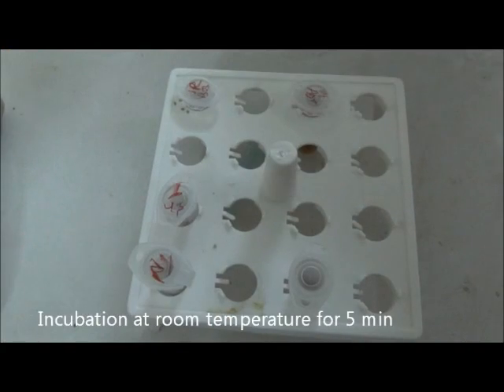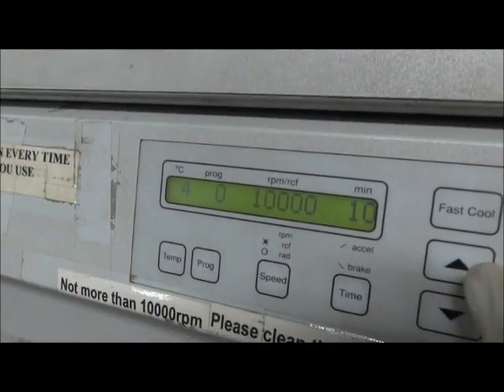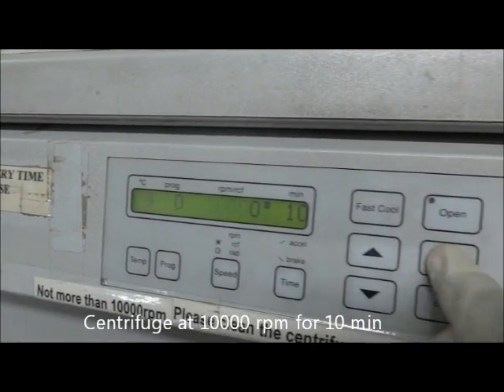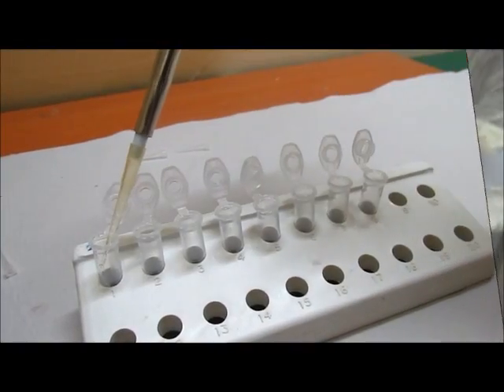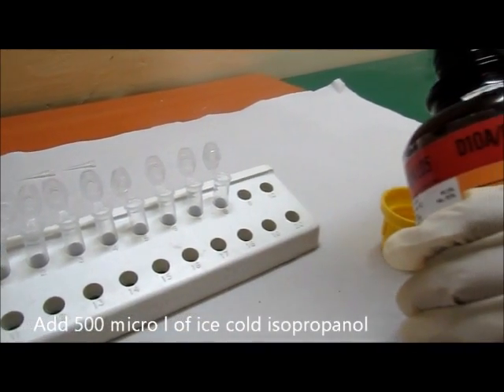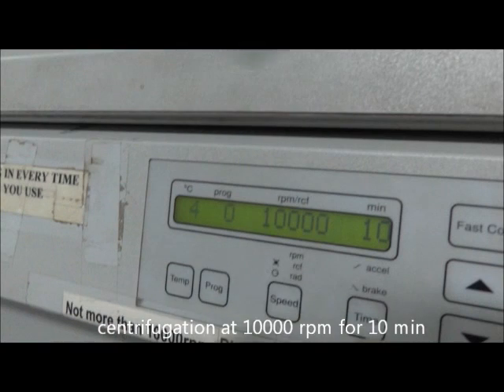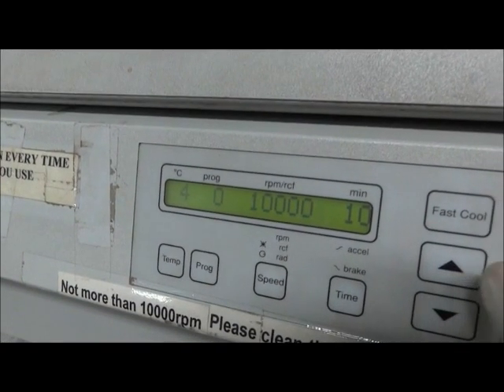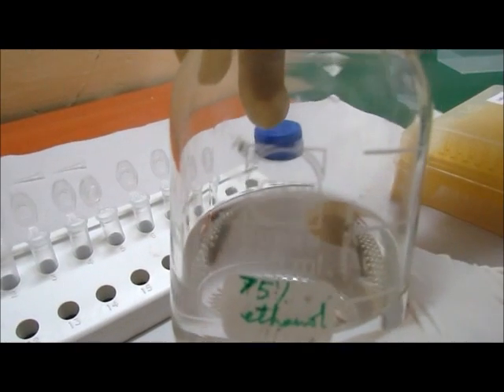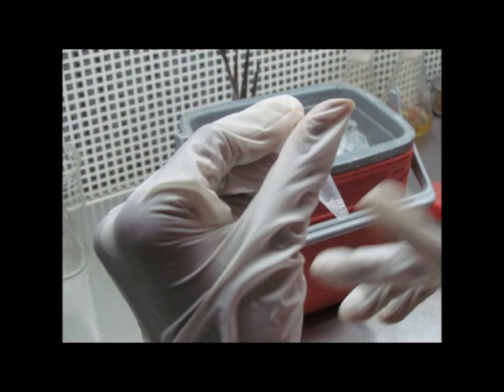After vortexing, incubate the sample at room temperature for 5 minutes. Then centrifuge the sample at 10,000 rpm for 10 minutes and collect the supernatant. Add 500 µl of ice-cold isopropanol for RNA precipitation and keep for incubation at room temperature. Centrifuge at 10,000 rpm for 10 minutes to get the pellet. Then wash the pellet with 75% ethanol. The RNA is dissolved in nuclease-free water and stored at minus 80 degrees Celsius.